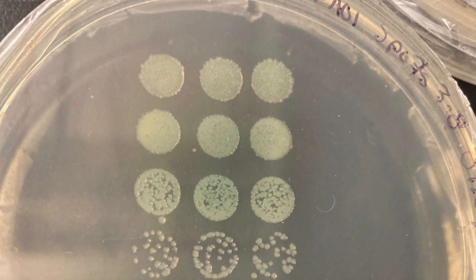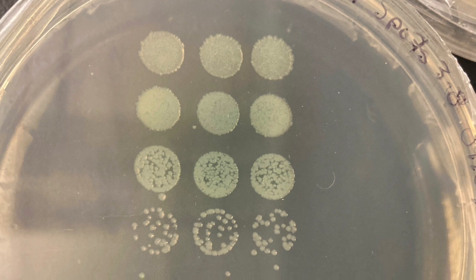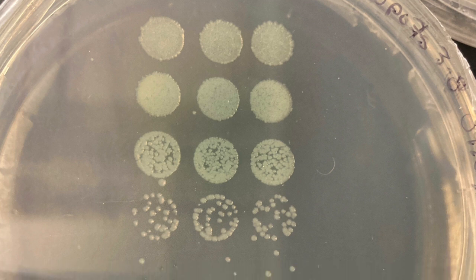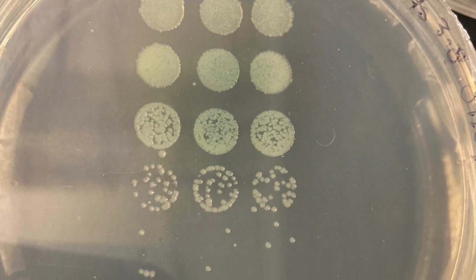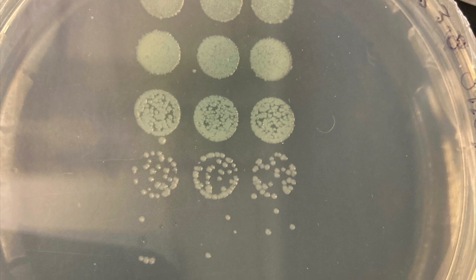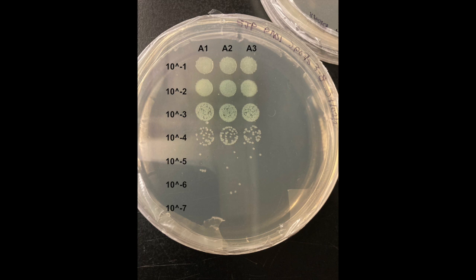After the spot plates have incubated for 24 hours in the 37C room, bacteria should have grown. Now to enumerate the bacterial concentration, start from the top, the most concentrated. Countable bacterial colonies are anywhere from 10 to 80 colonies, and for us this seems to be on row 4. Take note of the dilution factor that you are counting your countable colonies at. Also, remember that we plated 10 microliters of solution onto the plate, and then use the OD600 to back calculate the initial concentration of the stock bacteria.